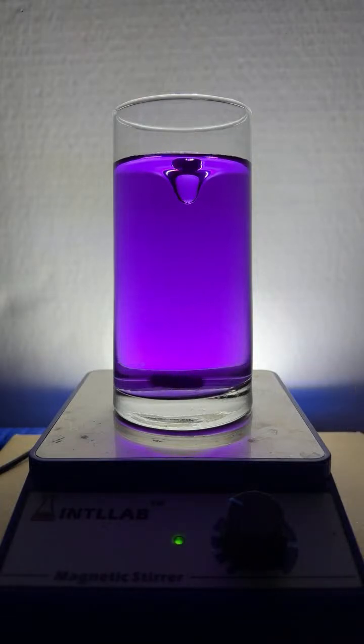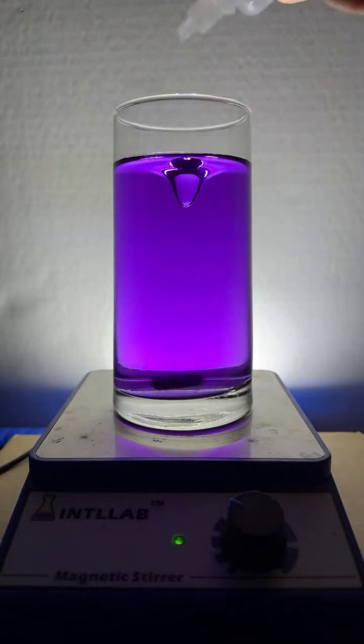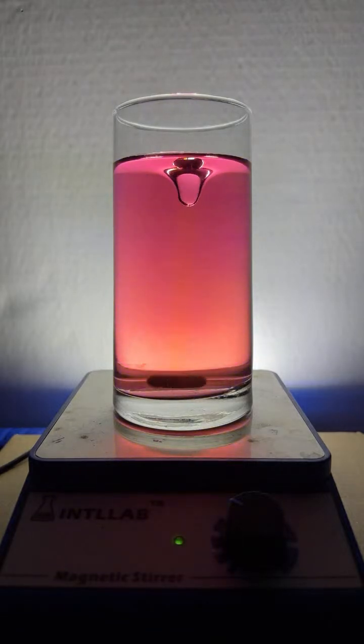I mean, I've got eye goggles on. I probably should be wearing gloves. But these dropper bottles really make it quite convenient where I don't really need to wear them. Every once in a while, I'll spill a little on my hand, but I have some water nearby that I just use to rinse everything off.